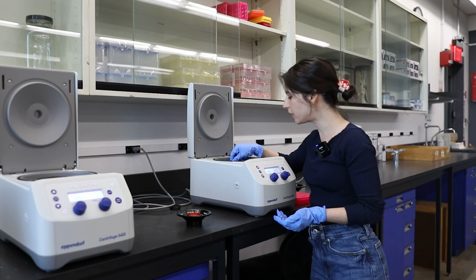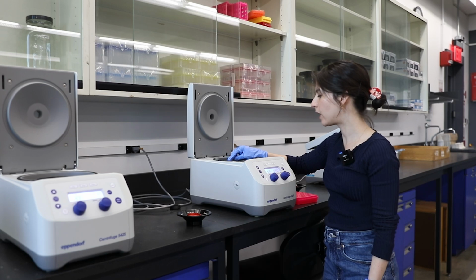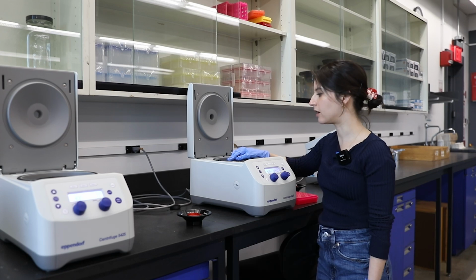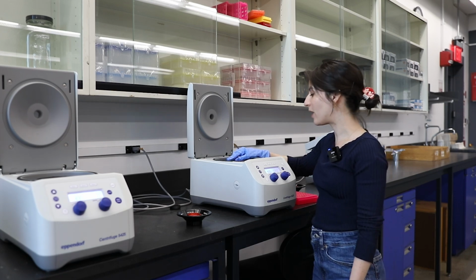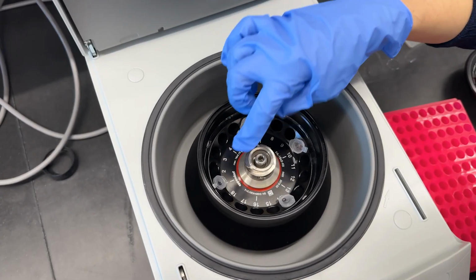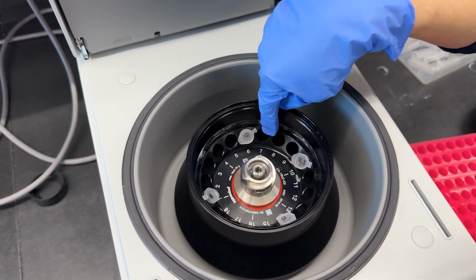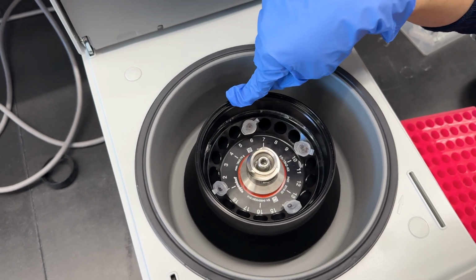Okay. Another important thing is whenever you're centrifuging, you have to make sure that the centrifuge is balanced. If it's not balanced, it can literally explode. What do you mean by balanced? So if you take a look in here, this one has 18 tubes, and what I mean by balanced is that there's equal distribution of weight across all of these axes, you can think of them.